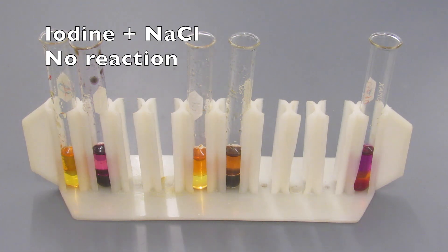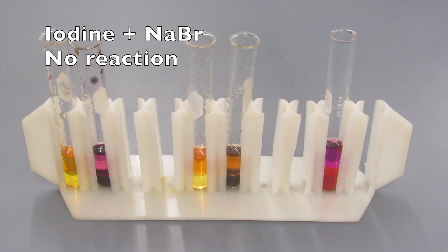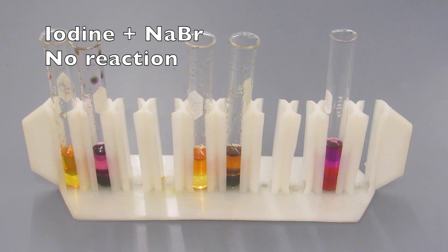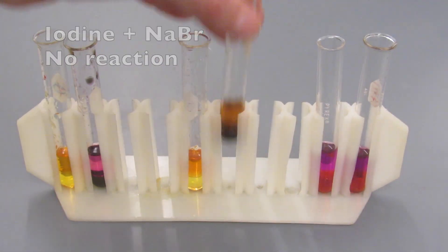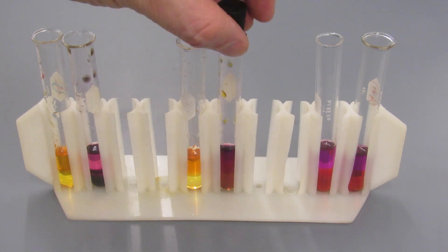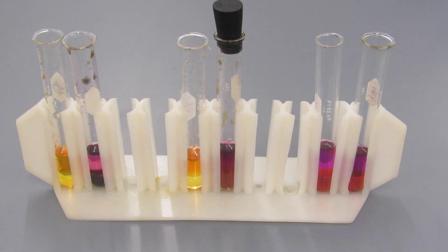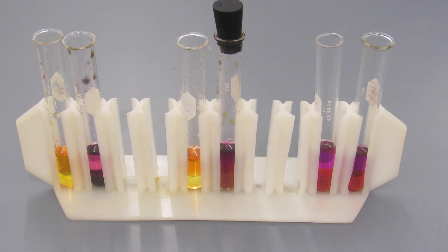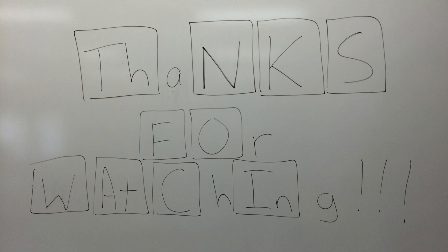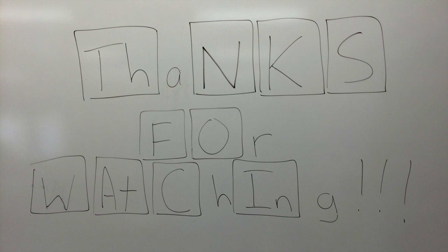On the fourth tube we can see iodine starting to form, but we're going to have to mix that one up a little bit more. And then the last two tubes we see iodine still there, so we can tell that there's no reaction. Based on the results of these experiments we can conclude that chlorine was the most reactive of the three halogens that we tested, with iodine being the least reactive.